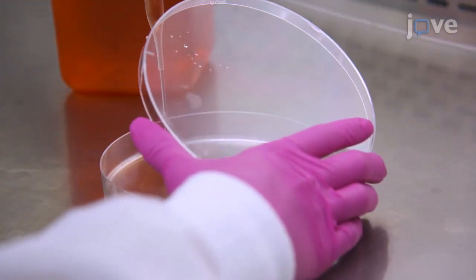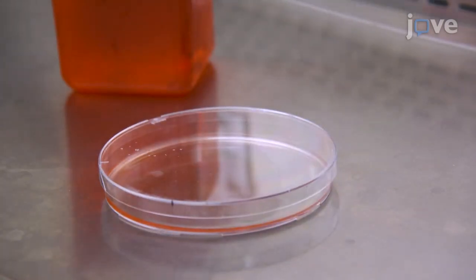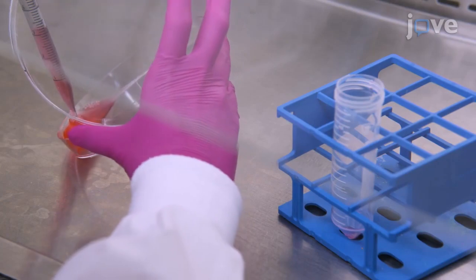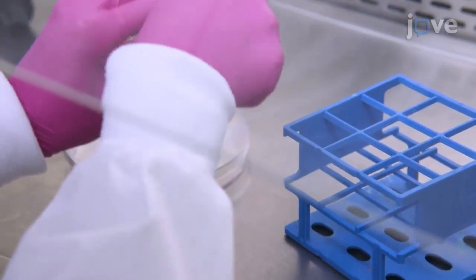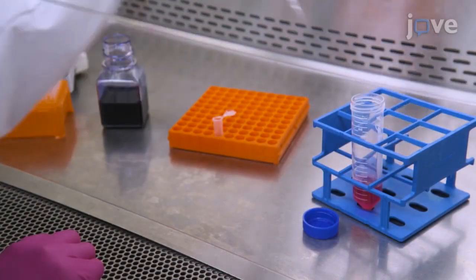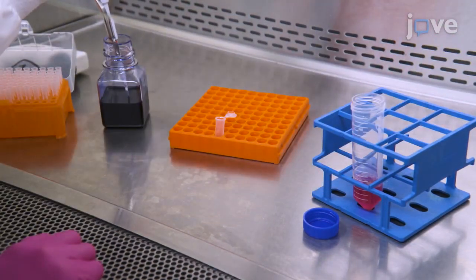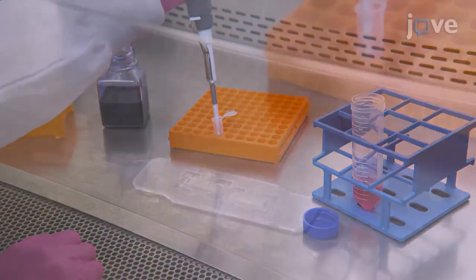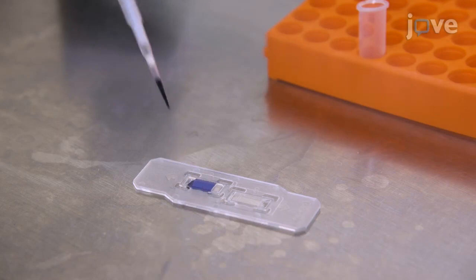After incubation, neutralize trypsin by adding 7 milliliters of complete DMEM to the plate, and collect the supernatant in 50 milliliter conical tubes. Gently invert the tubes to ensure the cells are homogenous. To determine the cell density, mix 10 microliters of the cell samples with 10 microliters of trypan blue, and add the mixture to a cell counting slide to analyze in the cell counter.